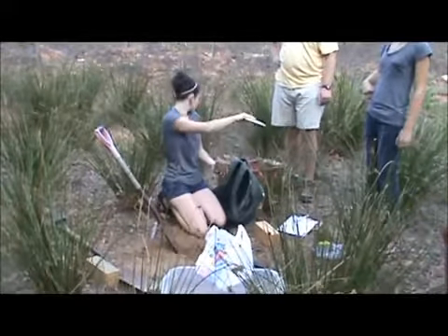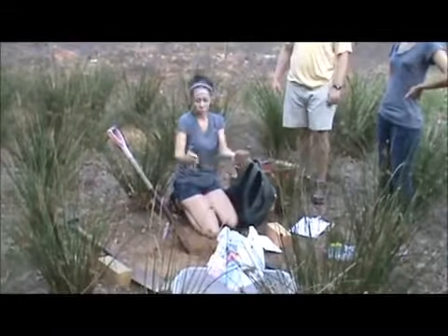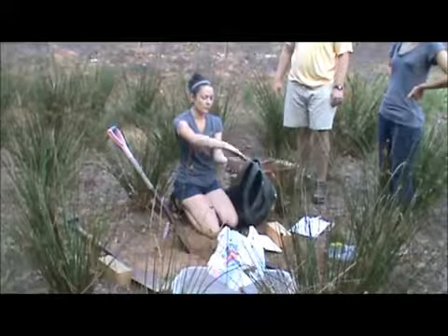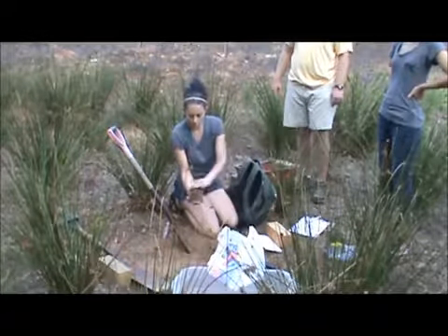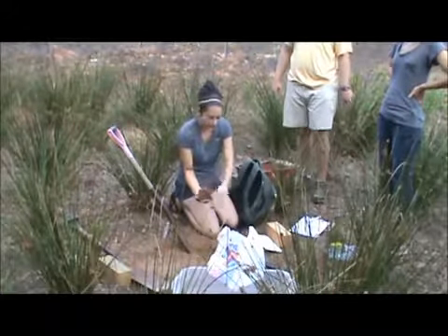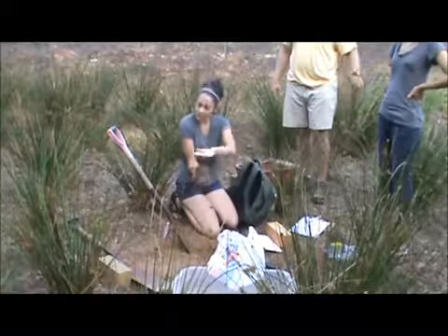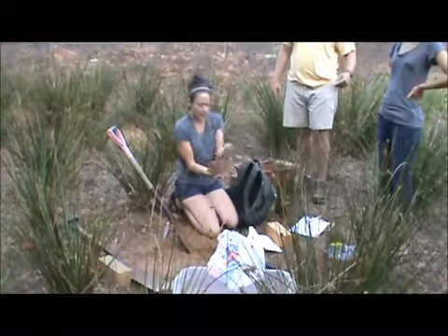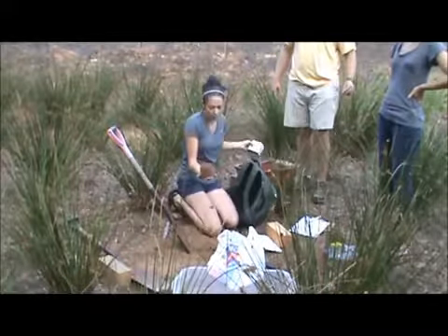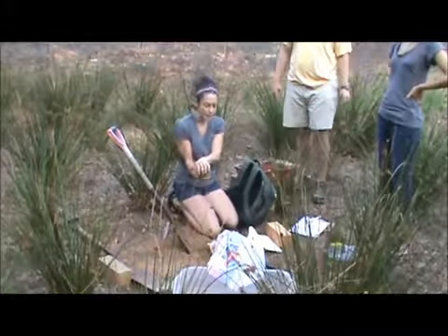Open it with your partner. We have scissors in there and you can cut out a long piece — about this much. You can lay it on top, flip it over, and clean this up. In the lab, we'll take the knives and lightly get it down to where it's level. Then you just wrap the cheesecloth around and we have rubber bands — rubber band it in a good X to keep that cheesecloth there.